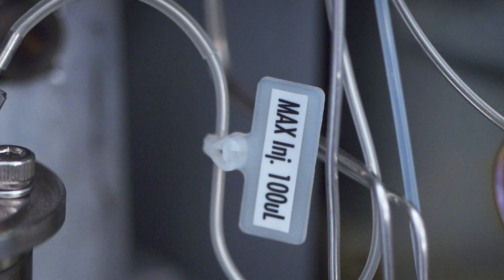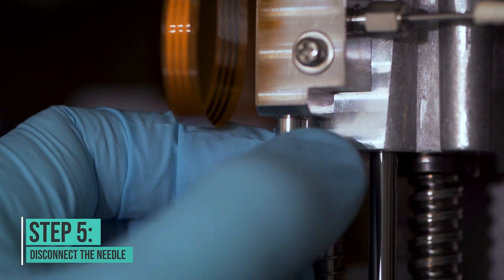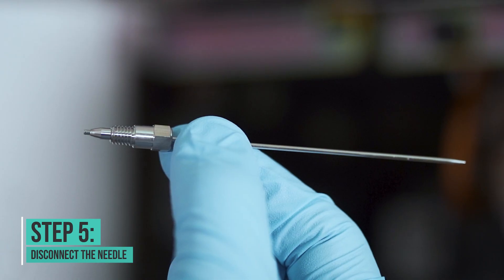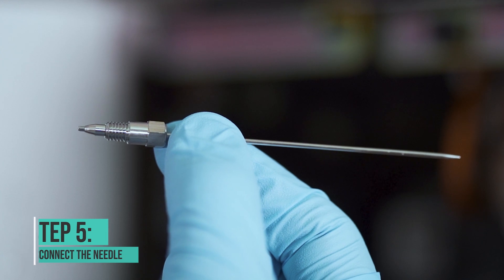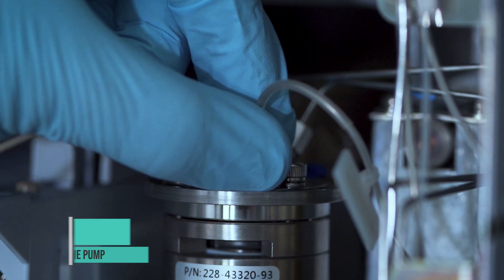If the injection loop is the culprit, then change that whole loop. If it's not the injection loop, then it's probably the needle. You can disconnect the needle and check that.